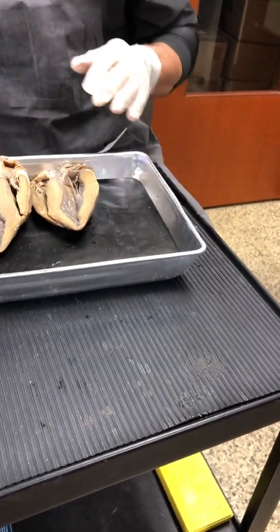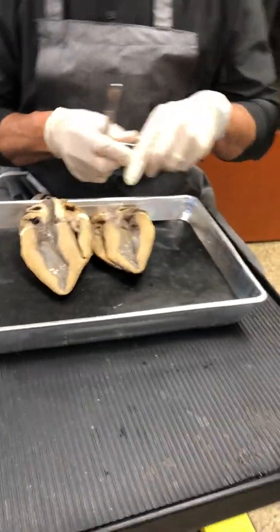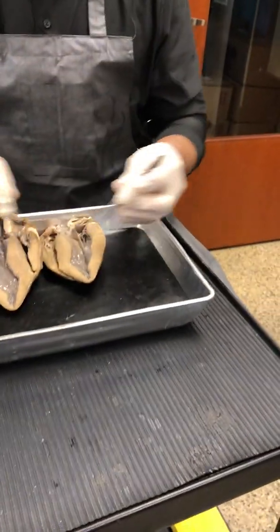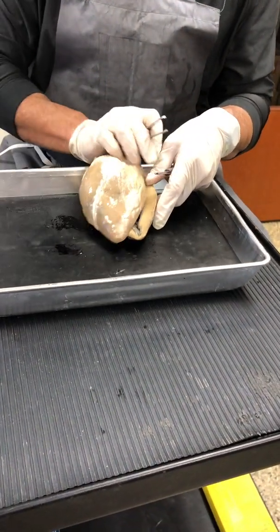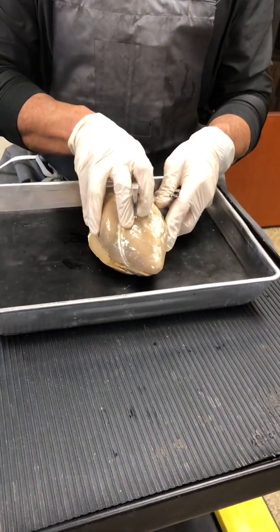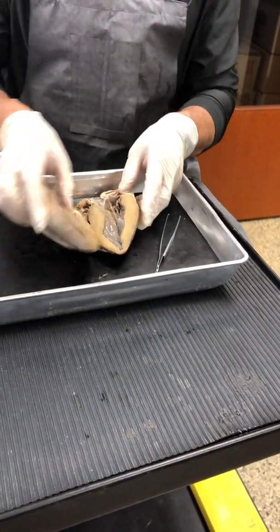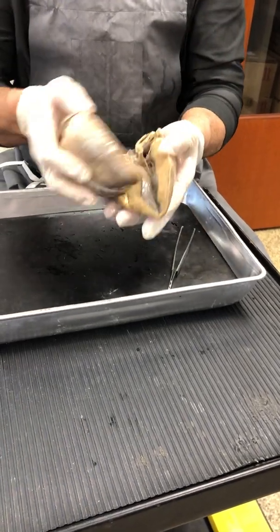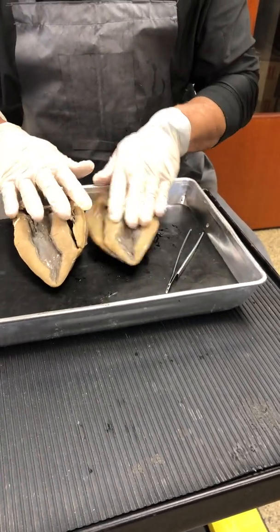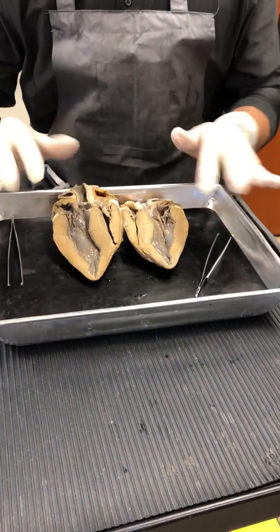And what I recommend, folks, is you have 2 forceps or 2 probes, etc. And why is that? Because these are the same organ. But notice what has happened. What did we do with this? We folded it like a page of a book. So they're the 2 pages of a book. But notice, same organ, 3-dimensional. So when I come around to you and help you, I just put it right there next to one another like that. And now we look at everything.